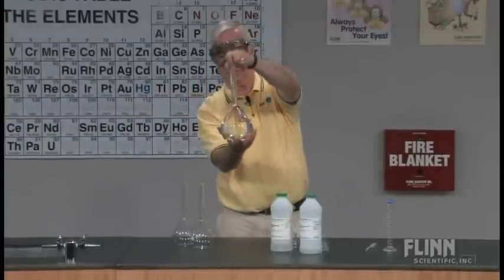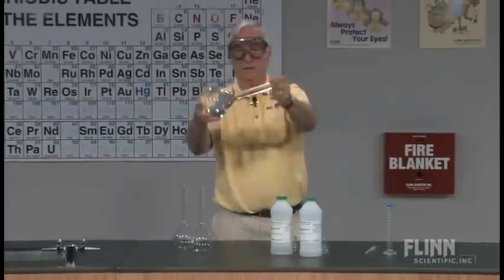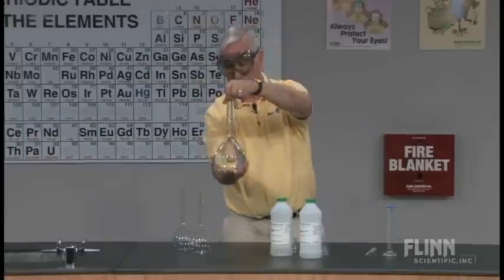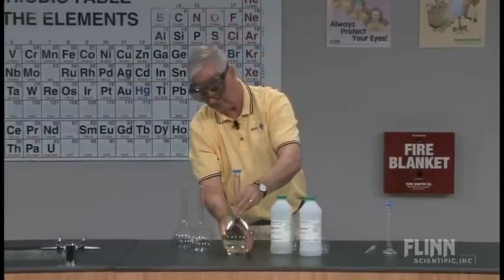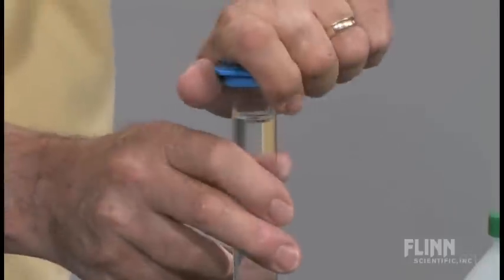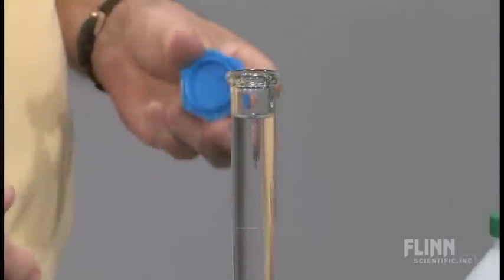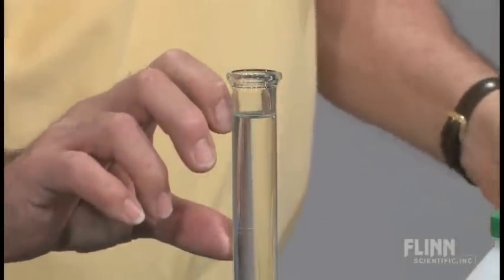I'm going to temporarily invert this just to be sure that we have total mixing and hopefully complete reaction between the two. We might notice that it has even gone up slightly further with that mixing.